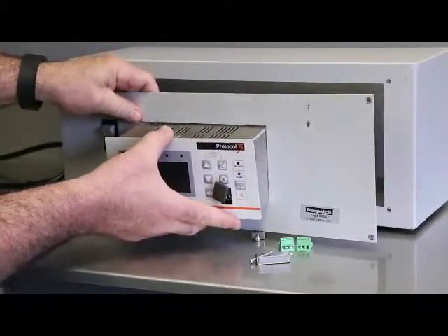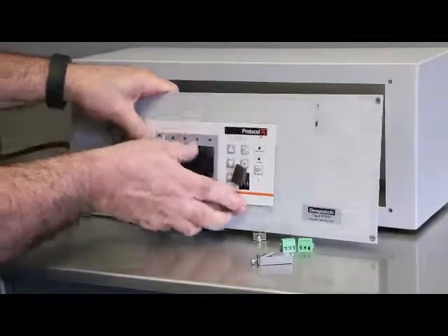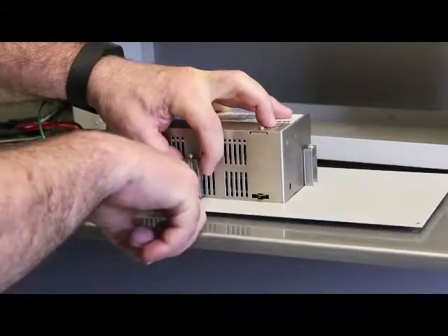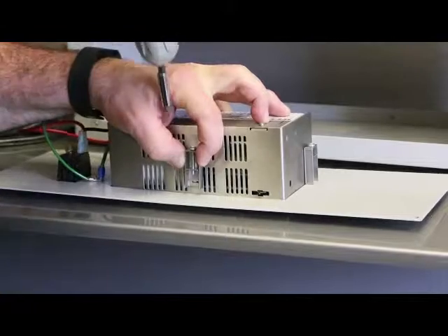Insert the new Protocol 3 controller into the panel. Loosen the mounting brackets to make it easier to attach and then secure the Protocol 3 into place.